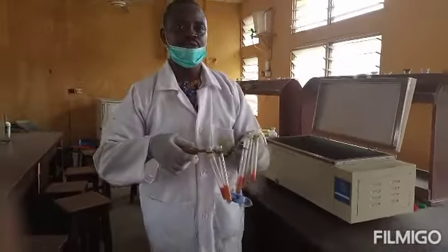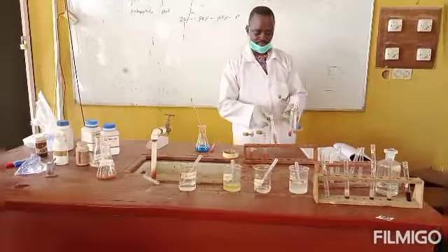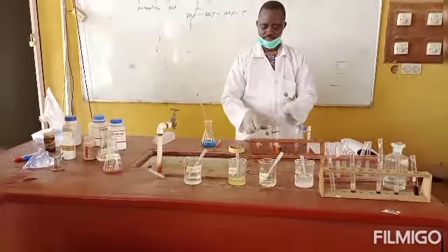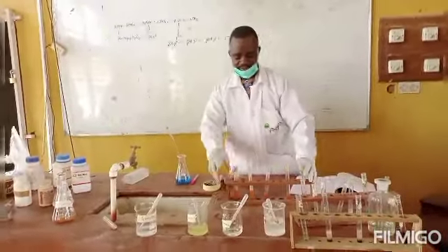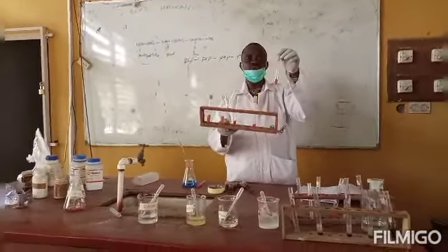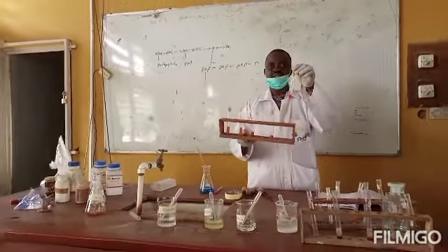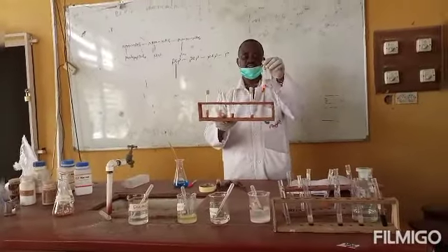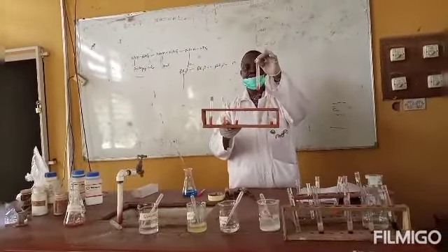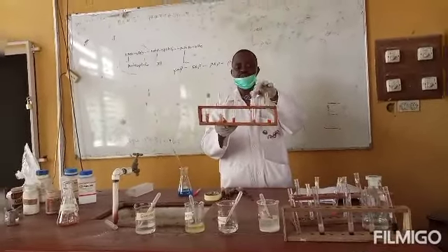Let's go back to the demonstrator table. Now, as we can see from test tube 1 to test tube 5, this is test tube 1 containing no water. You can see the color of the reaction after heating for 3 minutes. The orange color is highly intense and deep. The next one contains 1 ml of water. You can see the trend of the color now. It's fading out compared to test tube 1.